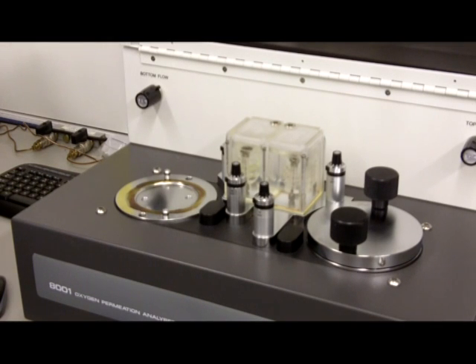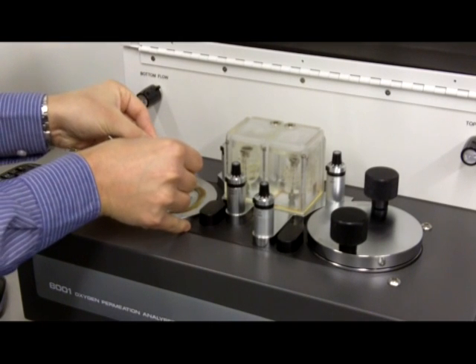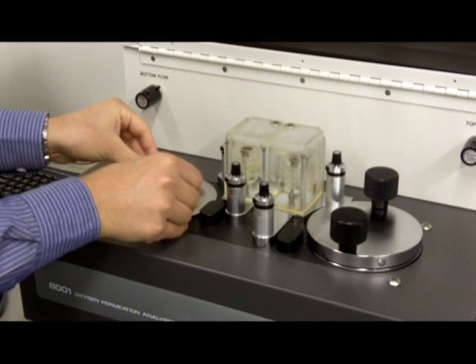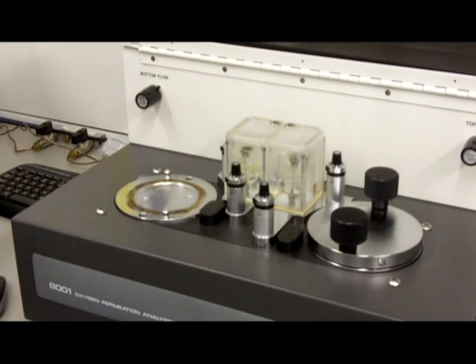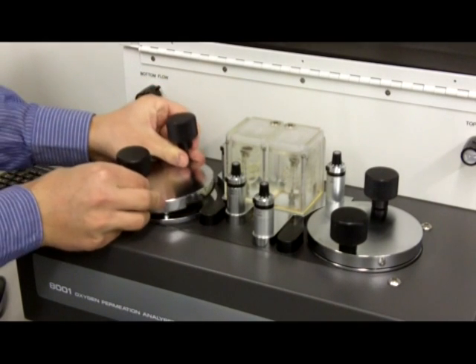Then place the film sample in position. Place chamber lid in position. Then tighten.